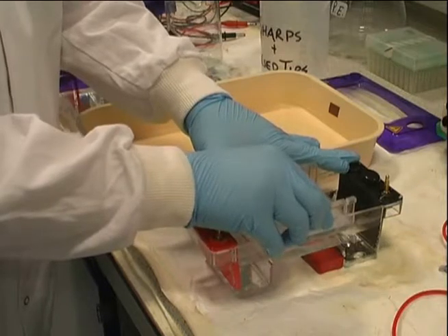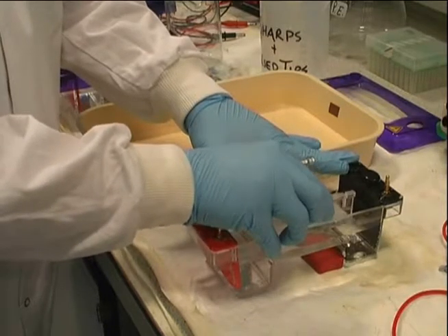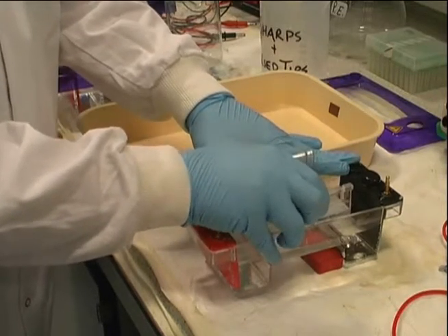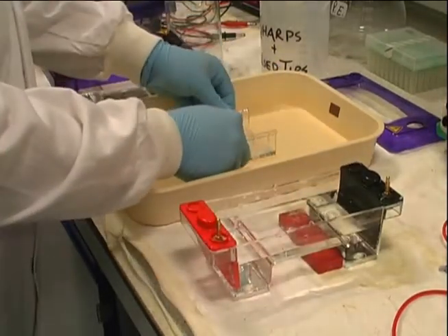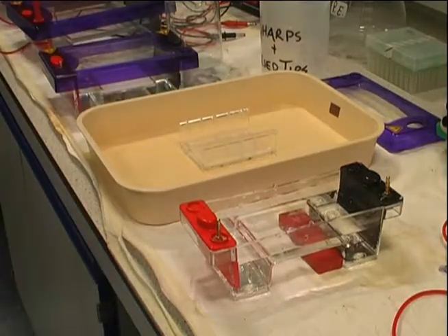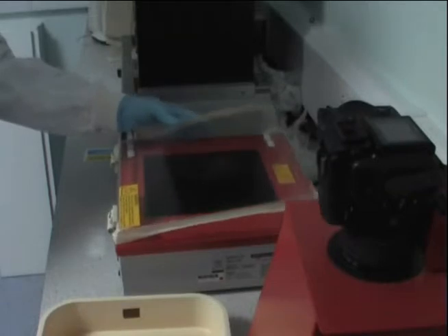It is now time to visualize our results. With great care, the gel cradle is removed from the electrophoresis apparatus. This is because a compound which allows DNA to fluoresce upon exposure to ultraviolet light was included as part of the gel. This compound is known as ethidium bromide, and is a severe irritant and a known carcinogen. Care must be taken when handling the gel, due to inclusion of this compound.